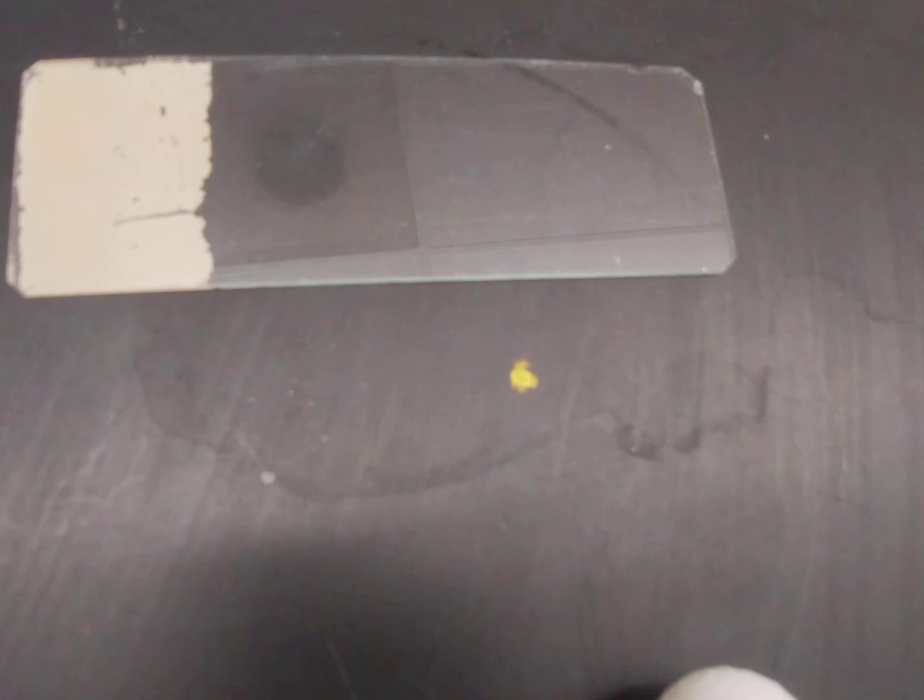Then you're going to incinerate your loop and take a sample of your bacteria and smear it directly onto the microscope slide.